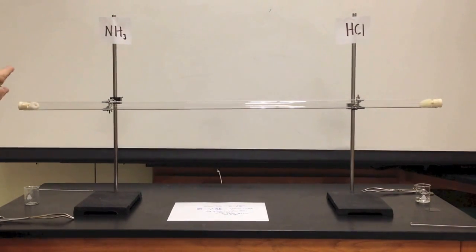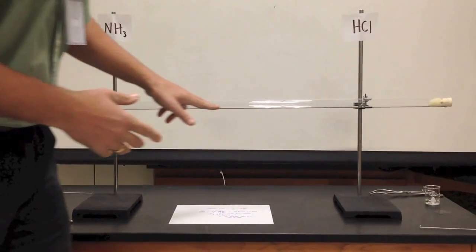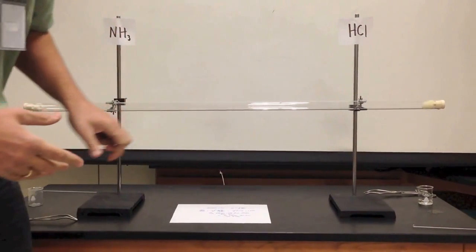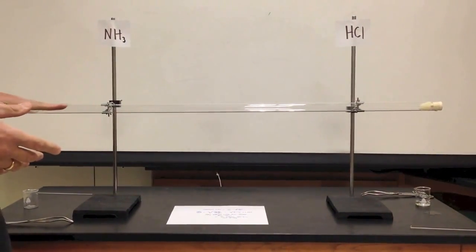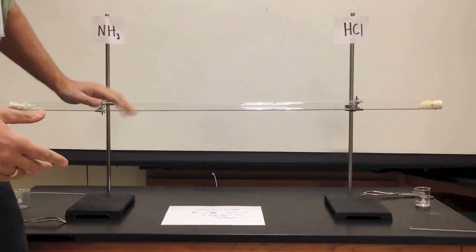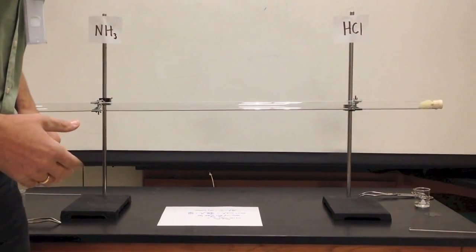We're going to have to wait a few minutes so we can see that line. So right now, the faster gas should be meeting my slower gas, somewhere in the middle here.